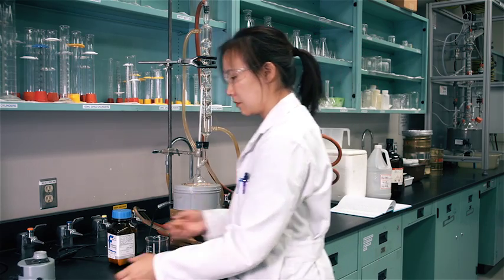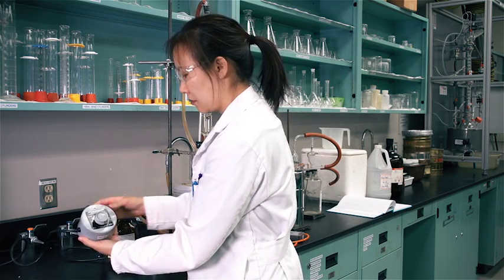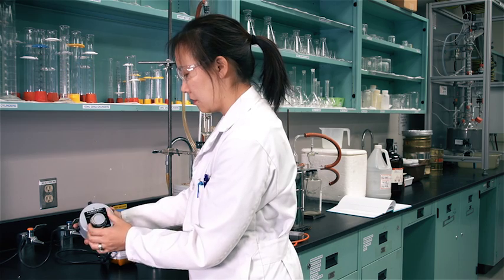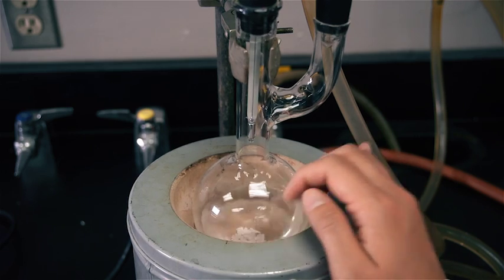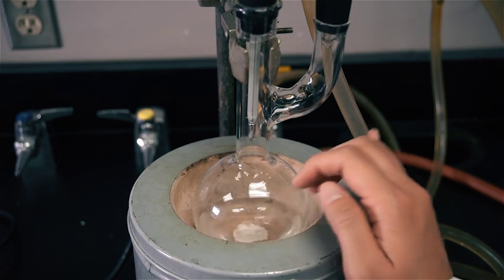Apply heat to the flask to bring the liquid to a boil. Adjust the rheostat and the lab jack to promote a slow, steady boil. Tapping the flask continually promotes even boiling.